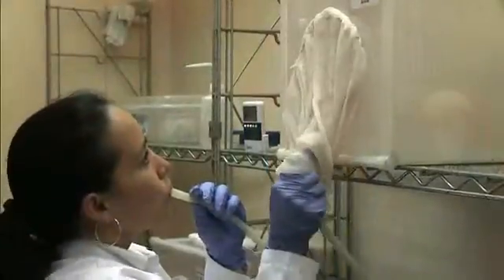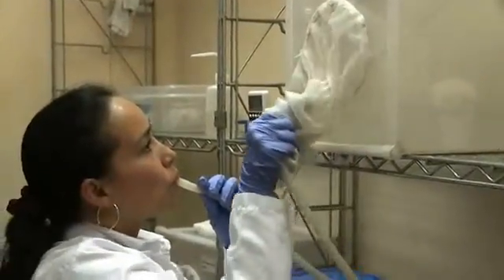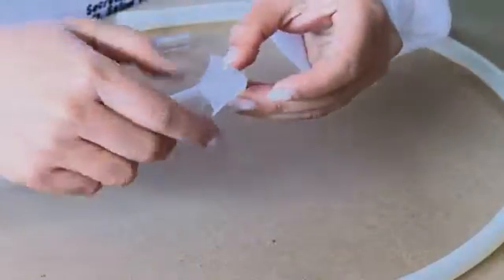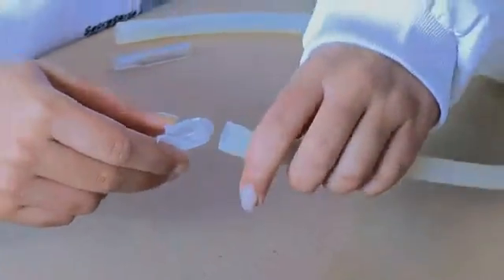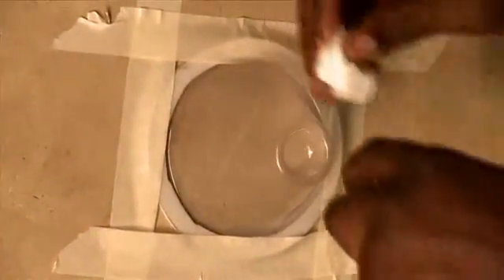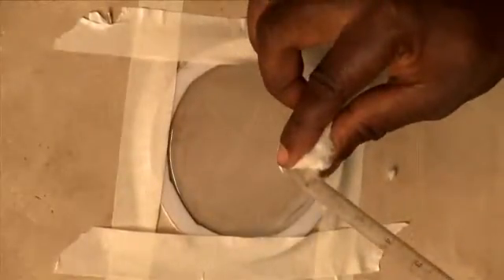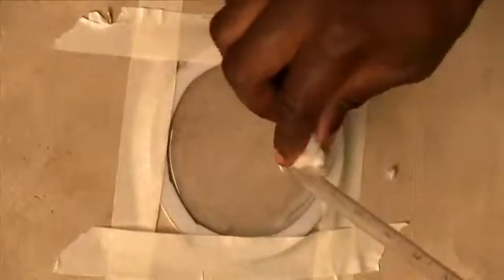When handling mosquitoes and preparing the bioassays, remember to use a filter in the aspirator to avoid inhaling mosquitoes or insect fragments. Blow gently to expel the mosquitoes into the cones. If the mosquitoes are blown too hard, they can be damaged against the sides of the test cones, killing them before the insecticide has a chance to do so.